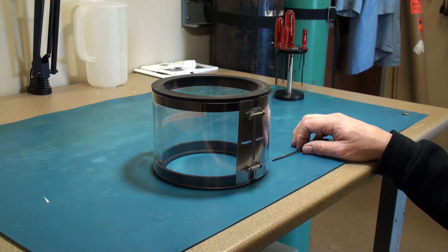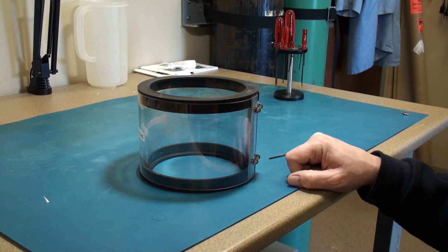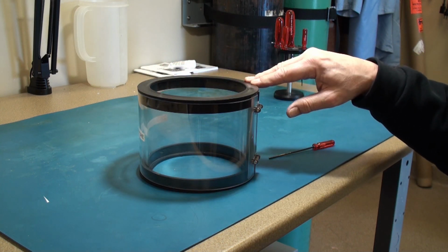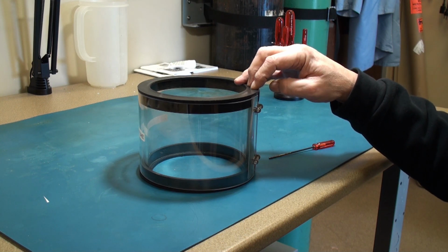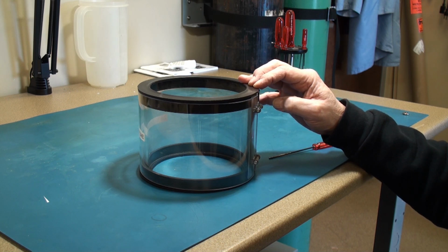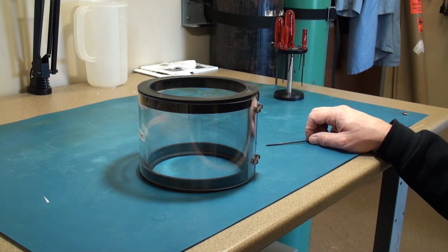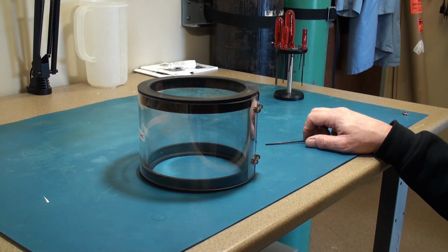And that's how you do it. It's not difficult technically. It's just a little cumbersome to do, but unless you damage the O-ring surfaces or they're more than 3 years old, that's when you should replace them. So you're not doing this terribly often. So that concludes this video on how to change the L gaskets on the bell jar.